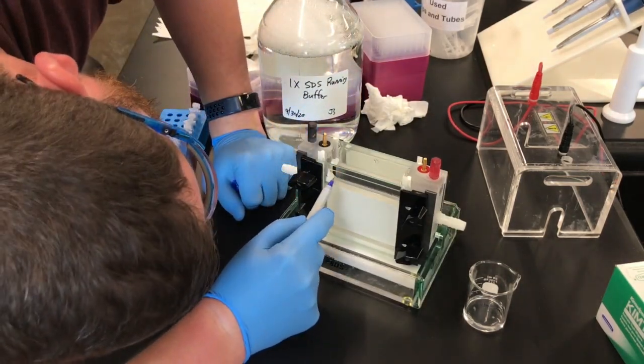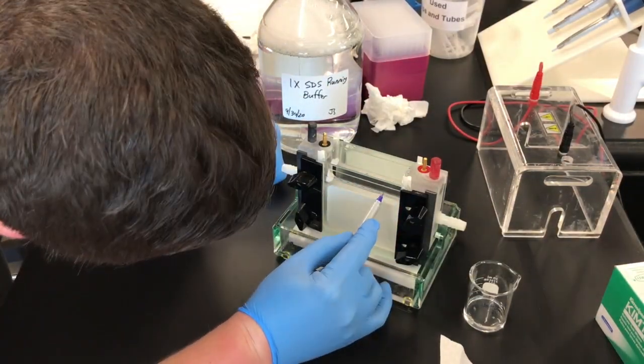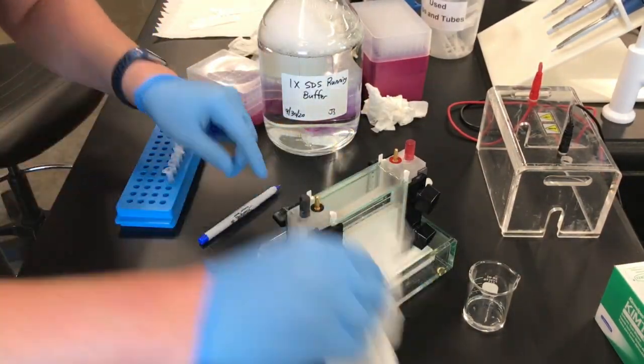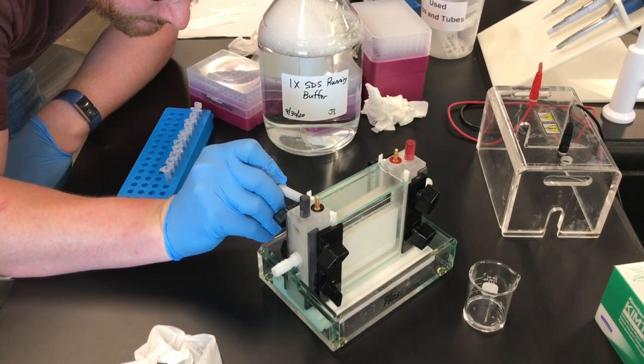This is probably better to do before you take out the combs, but you can also mark off the bottom of the wells to make it a little bit easier to see for whenever you are loading. I kind of forgot to do it here, so I clumsily did it afterwards.